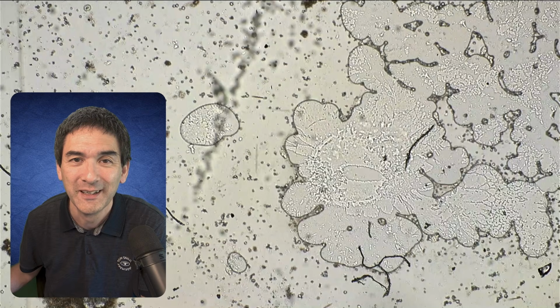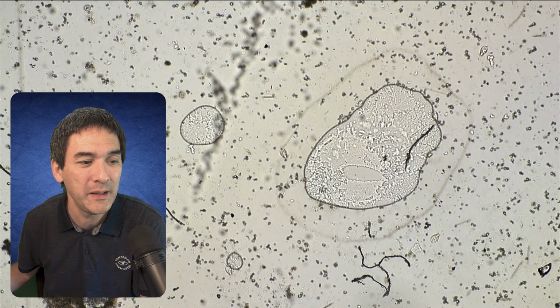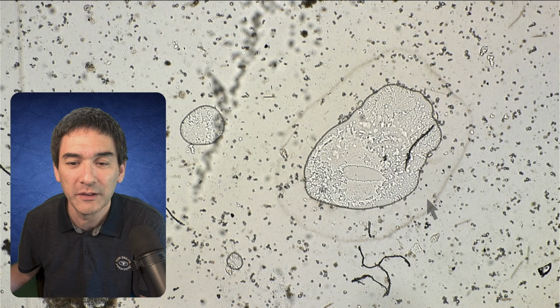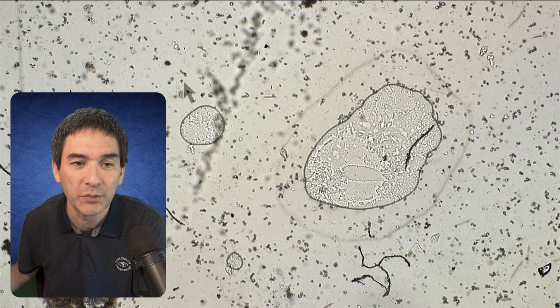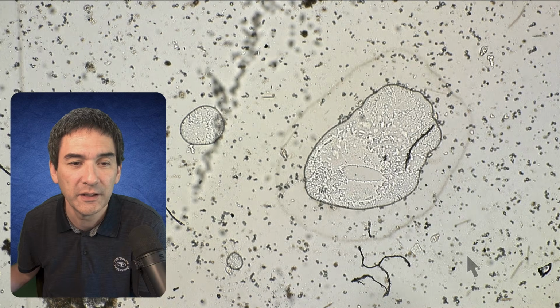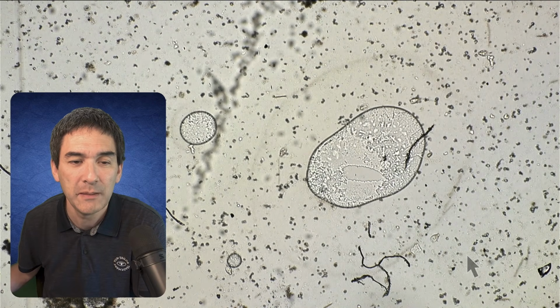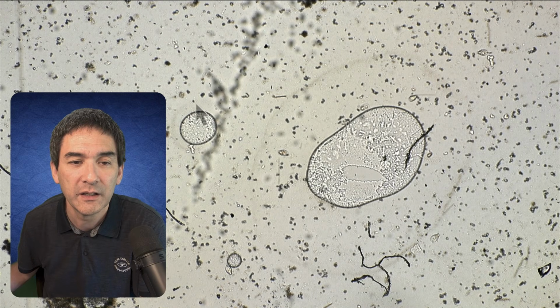Now here at the very end, you see that there's also air entering from the side because everything's completely dried up now. But when we go backwards, there's also a smaller air bubble over here on the left that I would like to show you. This one also forms this aerotactic band, so bacteria also start to form there. You might also want to take a look there, and you can see very briefly, let me stop the video over here, maybe you're able to see a very fine ring circle around this air bubble as well.